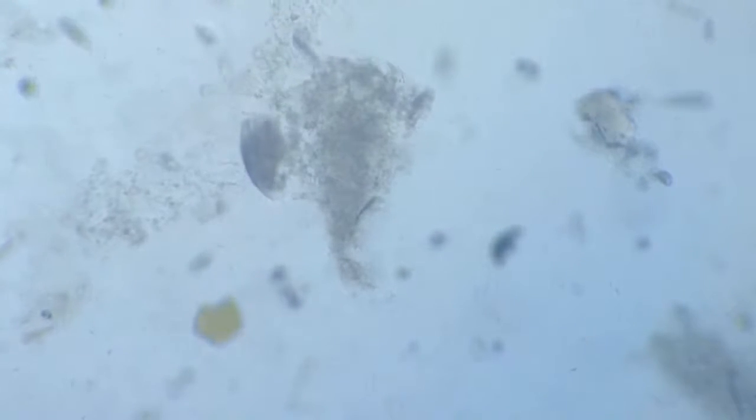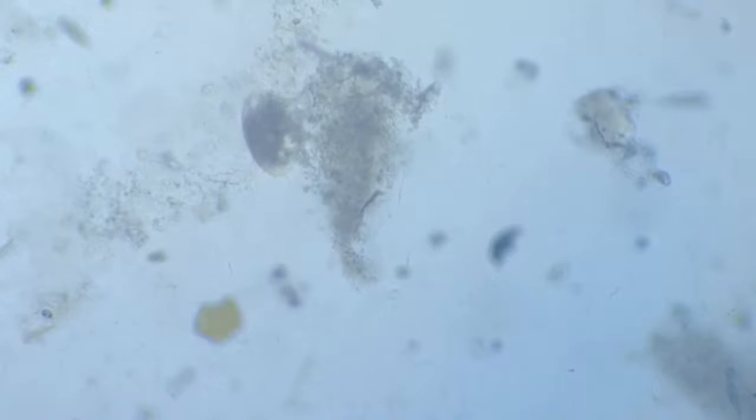Well, we must realize that since there is a mosquito lying trapped between the slide and the cover glass, there is a degree of difference in focal planes between the two, and hence it becomes a little difficult to keep a constant focus on all the events happening here.